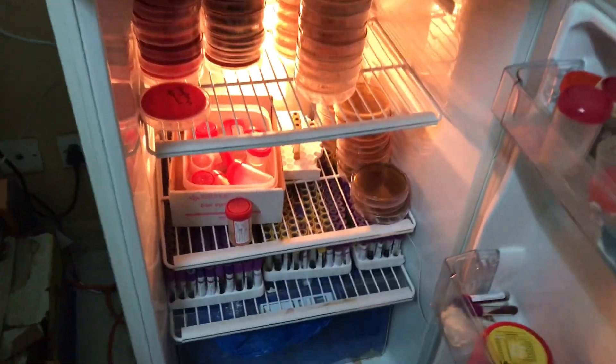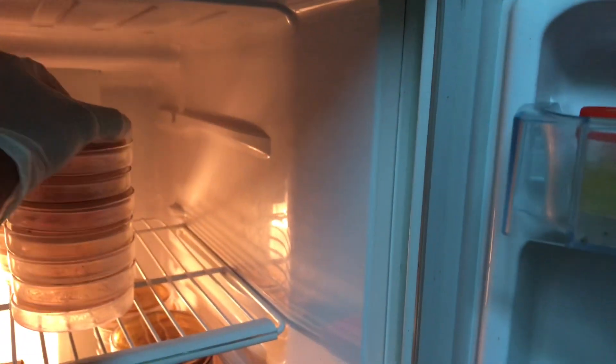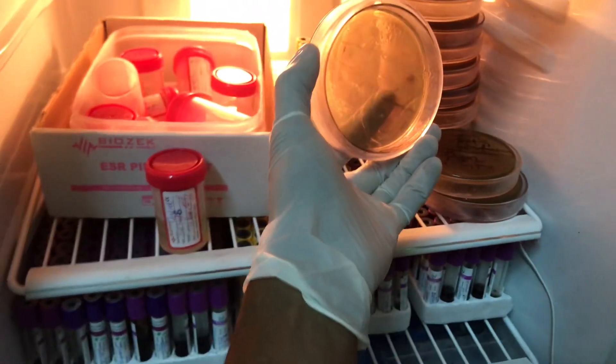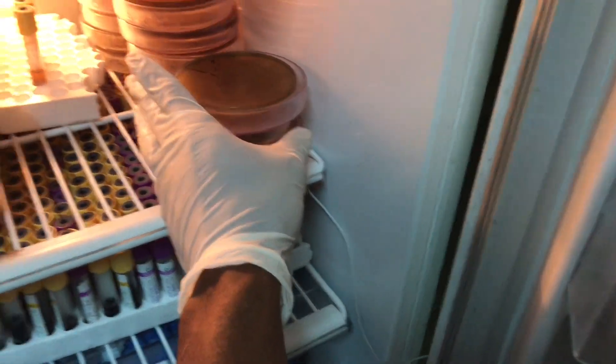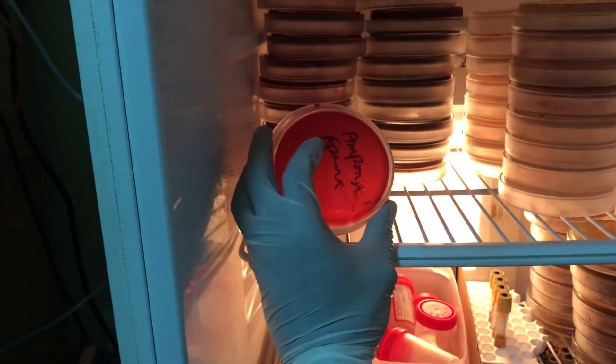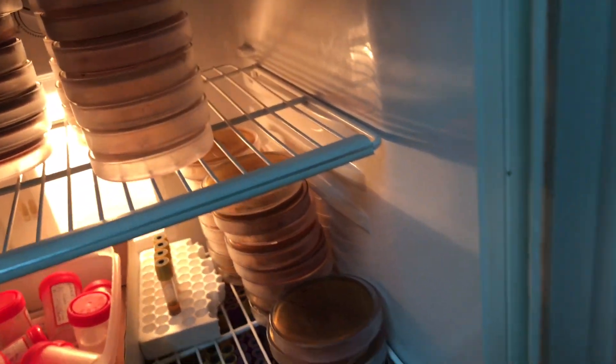We have our fridge where we store some of our samples and other reusables. In here we have some culture plates — we have CLED and then Muller-Hinton for culturing our urine specimens. The Muller-Hinton is for sensitivity testing. We also have a blood agar plate, a chocolate agar plate, and some urine samples here.